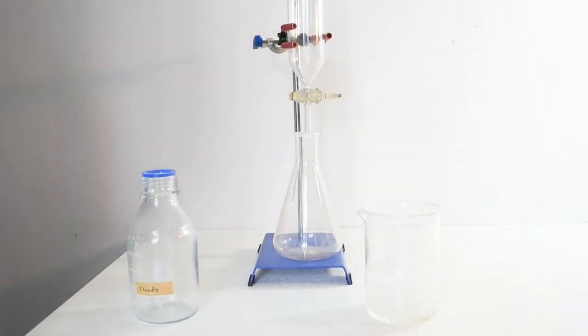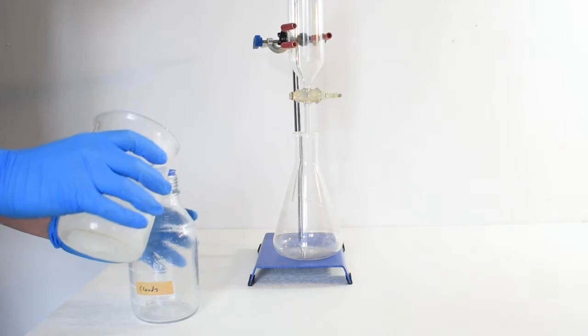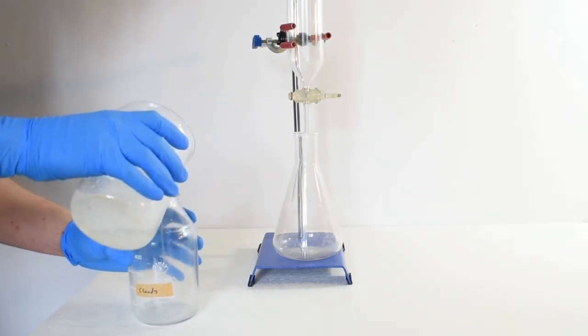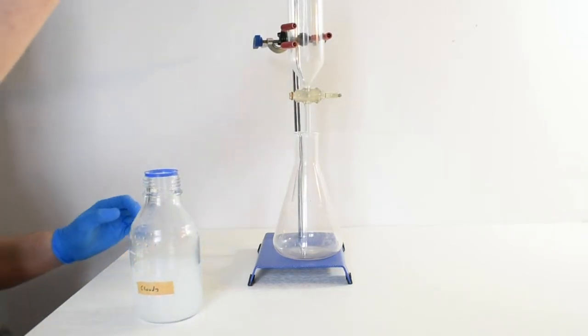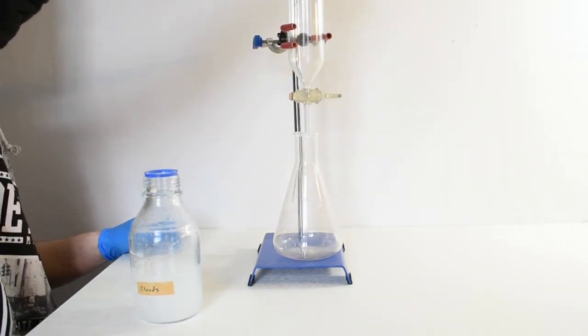The upper aqueous layer is decanted back into the bottle, while the lower DCM layer is decanted into a separatory funnel.